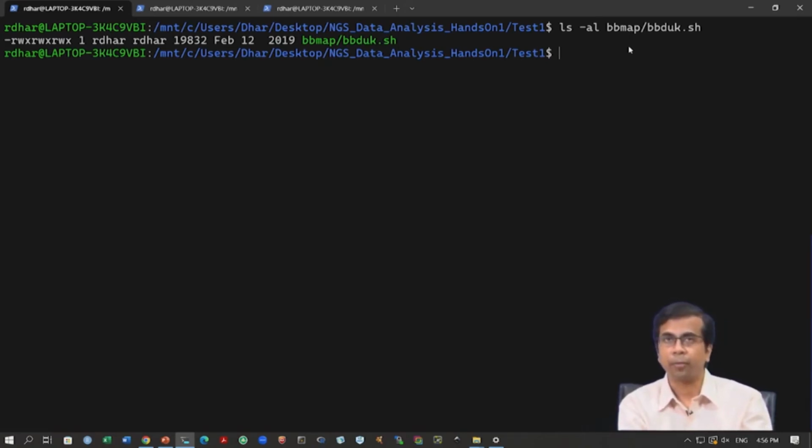It is very easy to set up. You just simply download the tar.gz file, you extract, and you have the function. You do not need to do anything for this program.